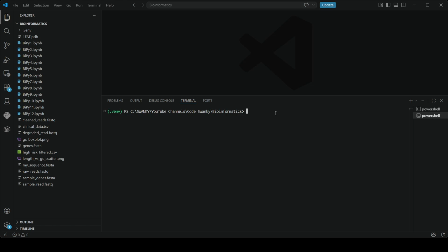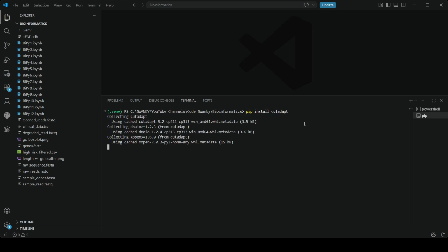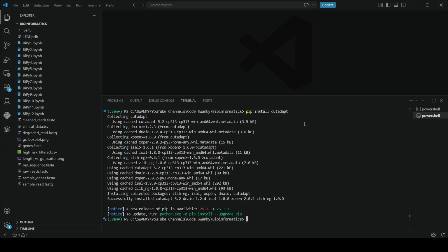Okay, because Cutadapt is a Python-based tool, installing it is incredibly simple. You don't need complex package managers. We can just use our old friend pip. Since I have it already installed, this command will just tell me that it already exists, but I will run it again so that you can see and copy. So if you run this command, okay, it installed it. I think it got reinstalled or maybe it got updated. Once that is done, we will verify that it is installed correctly by asking for its version. Cutadapt --version. And yes, if you see a version number like this pop up, you are ready to process some real genomic data.